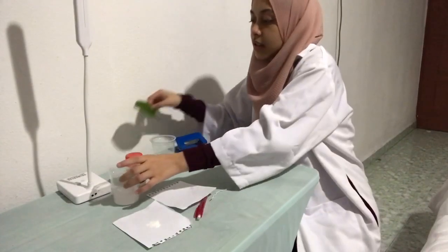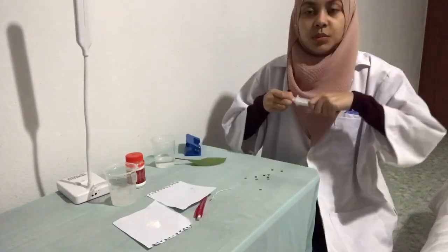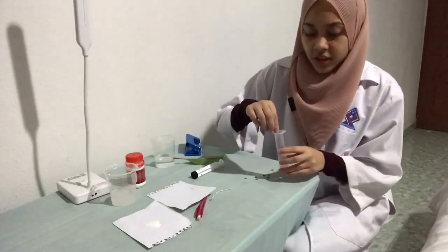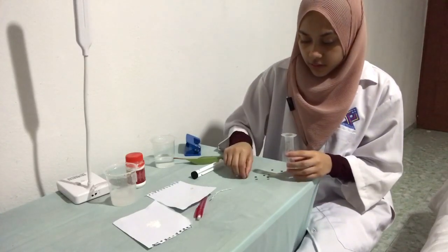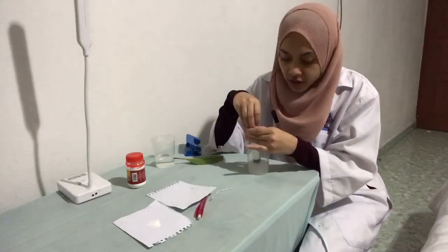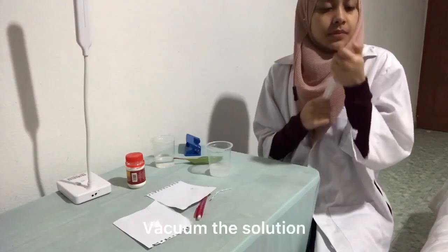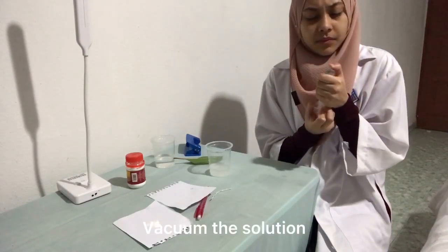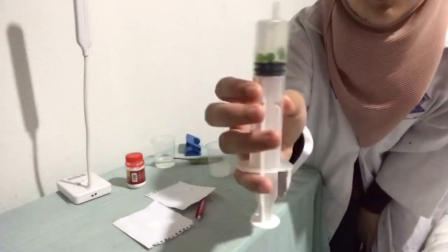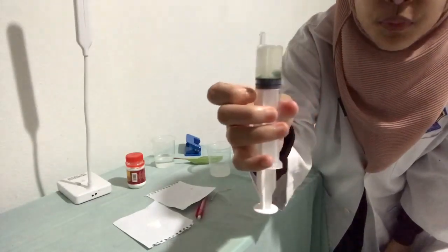Okay, and then make a leaf disc, 10 leaf discs. And put the 10 leaf discs into the syringe. Then 6 to 8 ml into the syringe. Okay. All the leaf discs are sucked in, and then we have to pour it into the glass.